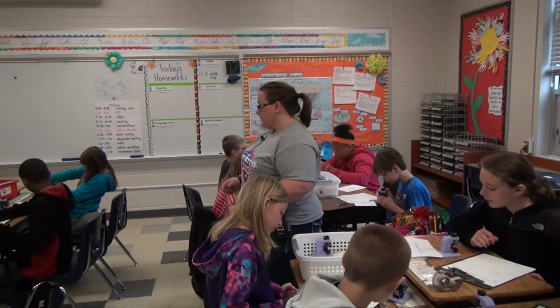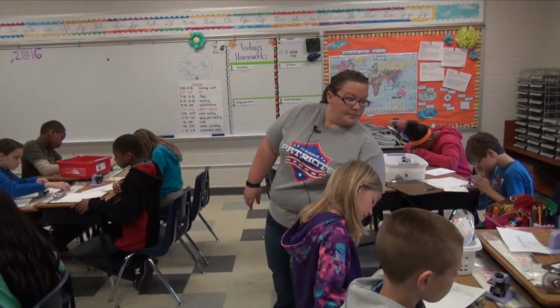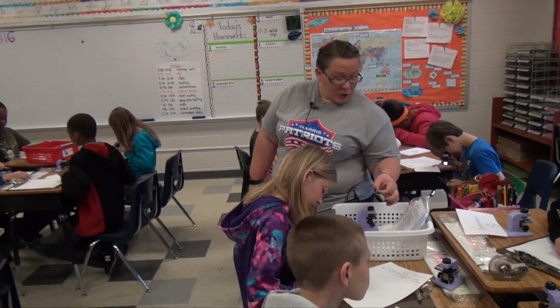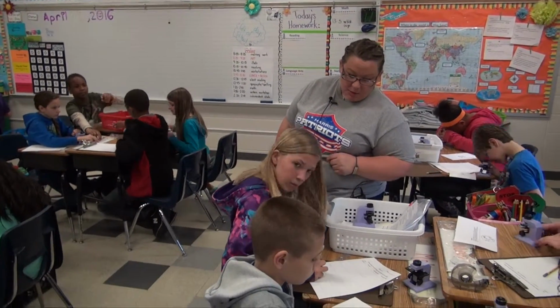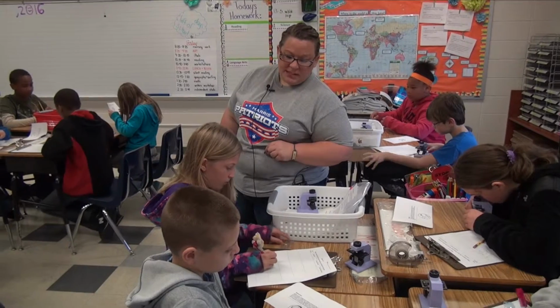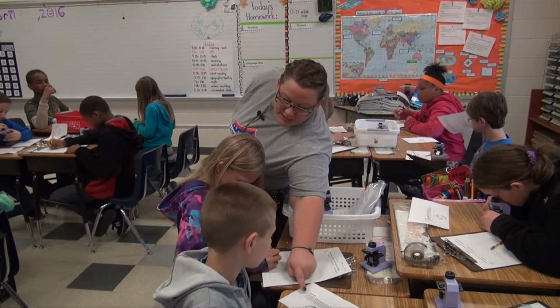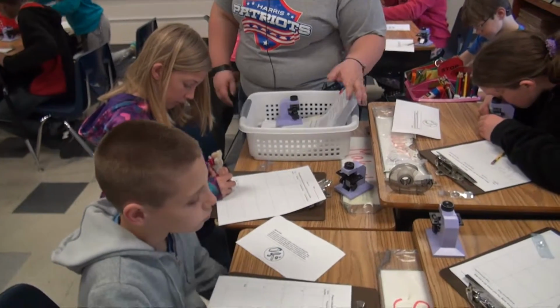I'm sorry, what? What do we do for the predictions? So you need to decide when you look in your well, of the 4 options that it could be, what do you think, just based on the description, on the clues, that substance could be? Does that make sense? So read this. And then you're going to determine, based on your slide, what slide are you working on first?